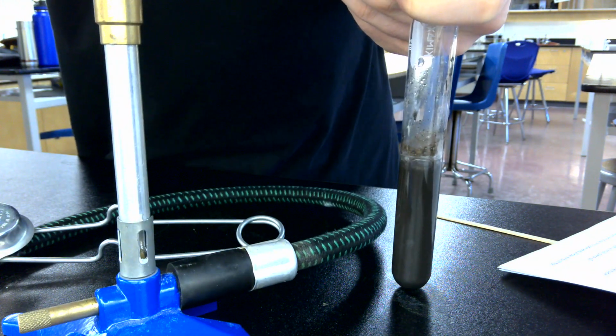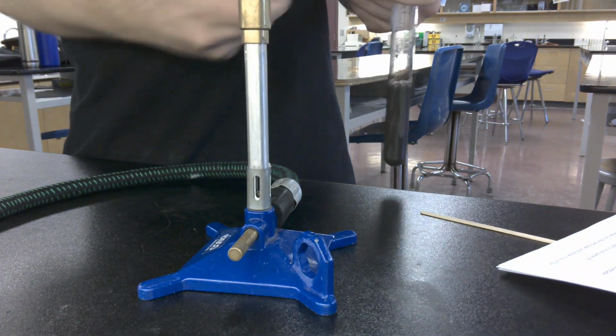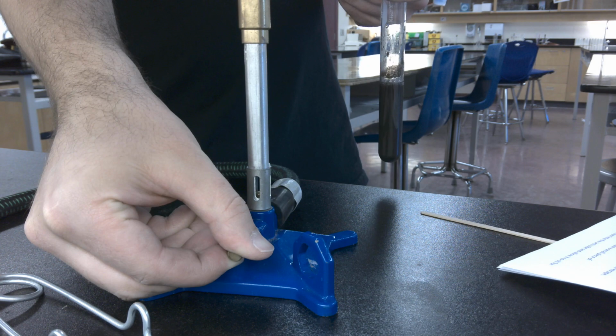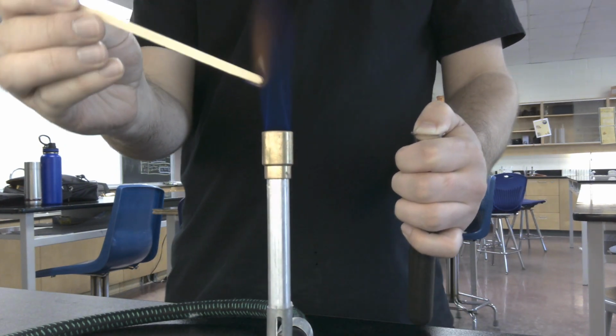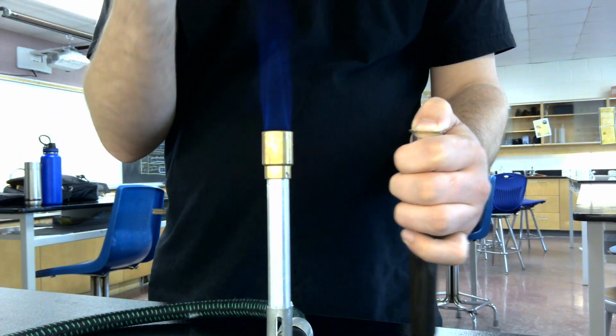Relight my Bunsen burner here. So we're not burning the bookshelf there. Okay, there we go. So there's our Bunsen burner and our test tube with hopefully trapped gas. We then need a burning splint. What we're going to do is introduce a glowing splint into this. That means we're going to set this thing on fire, wait for it to get to the glowing stage, and then blow it out.